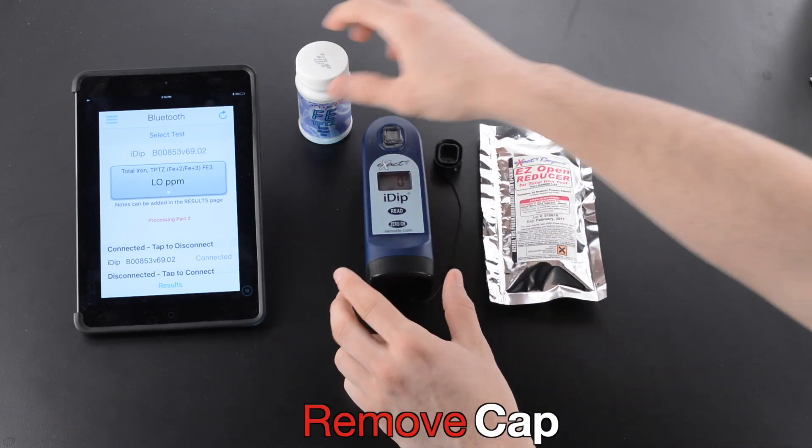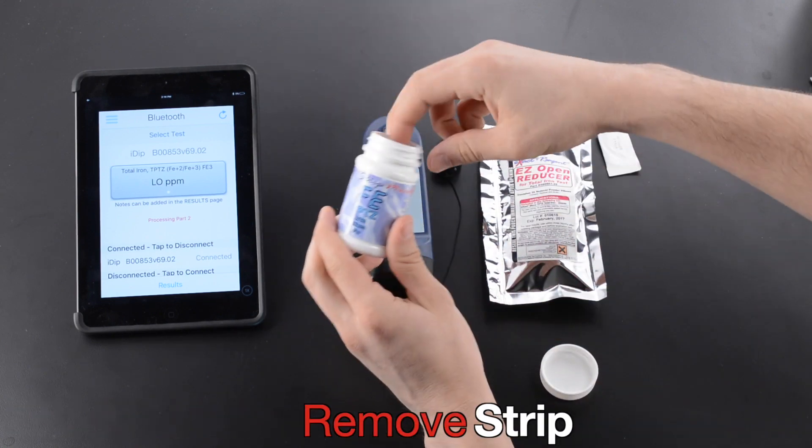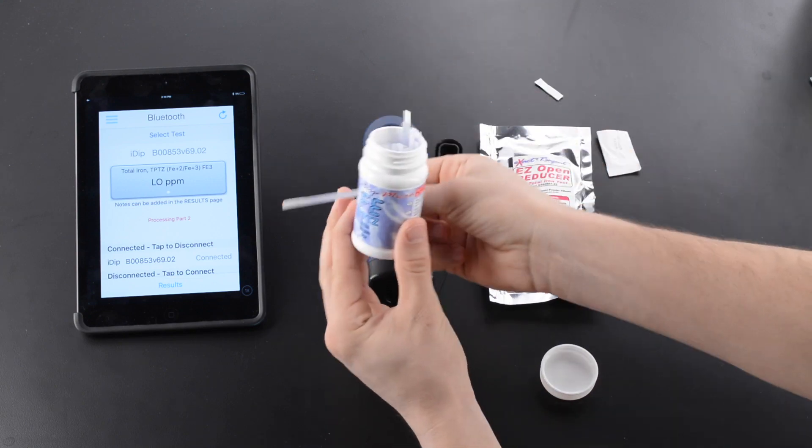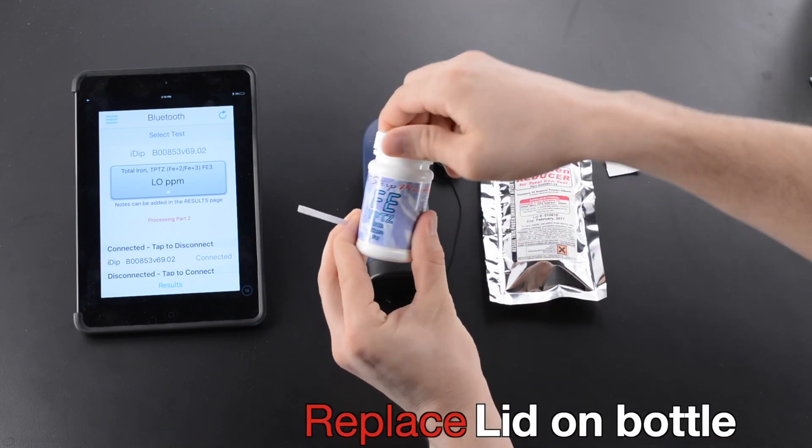Remove Cap. Remove Strip. Replace Lid on Bottle.